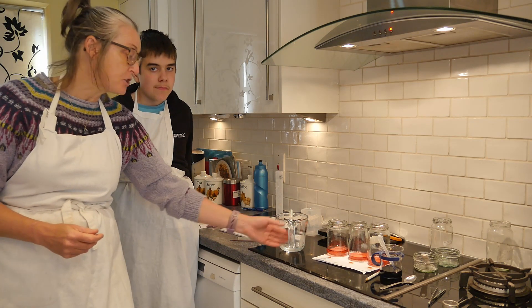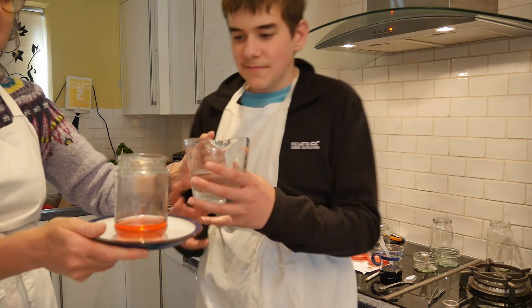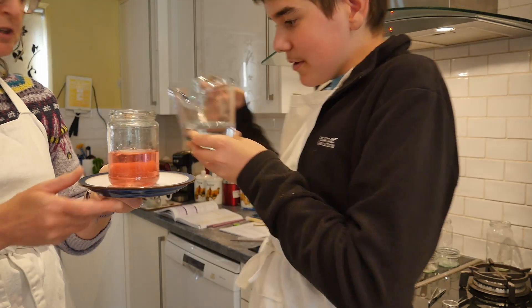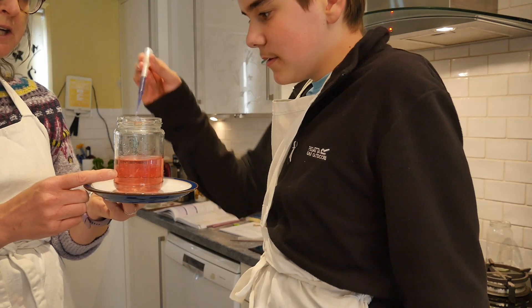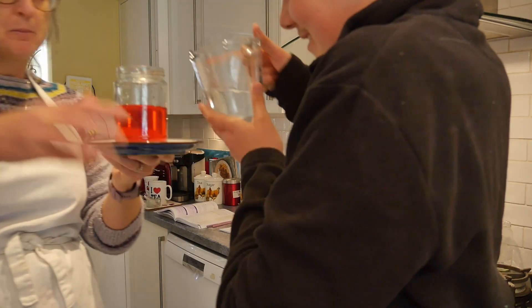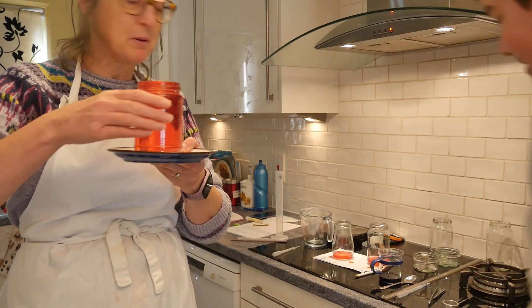Let's take the jug of water and just add water to the one molar solution to see if we can make it go any weaker. Are we actually watering down the indicator solution or are we changing the pH? Remember, the indicator solution is purple at neutral. Let's go all out — are we getting any nearer to purple? We've still got H plus ions in there. Actually, I am seeing a slight tinge of purple now.